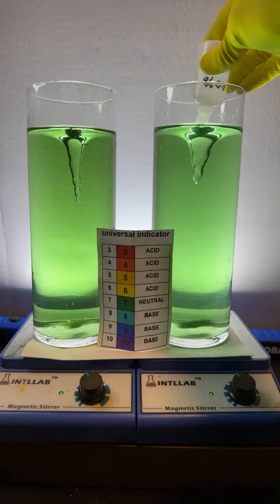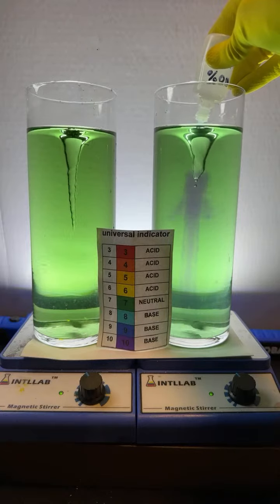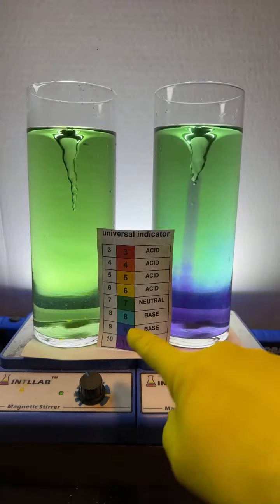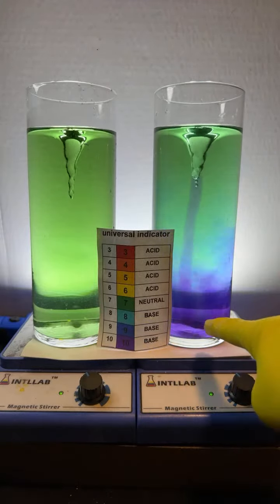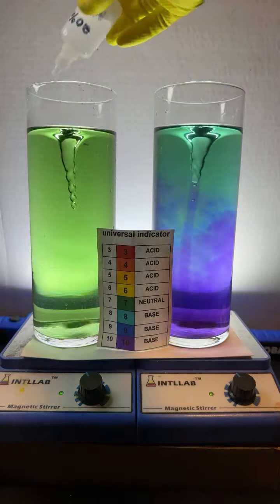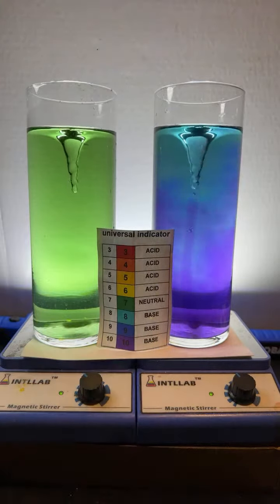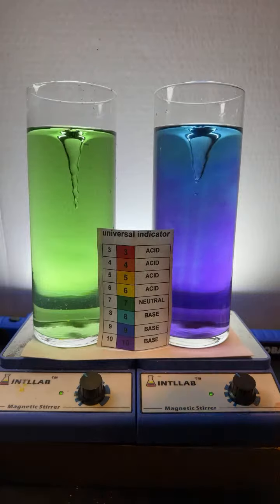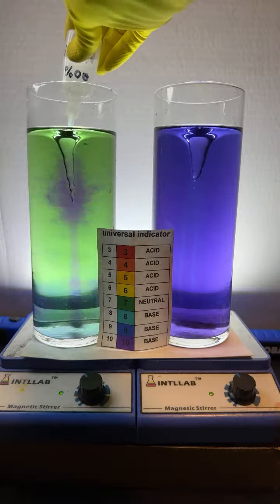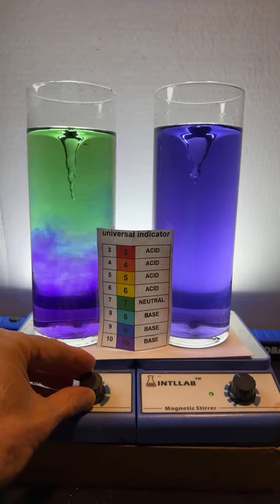I'm going to add a bunch of base here. I'm going to add drops of base, and you can see that it kind of stays in the center. You see that? The material stays in the center. I can see it because that's where the blue stuff is. Now, of course, it gets to the bottom, and it gets pushed down around the sides. I'll do it over here on this side, too. It's not a perfect system because it's kind of small. But imagine an infinite bath of water around this. We wouldn't have to worry about the stuff going down the sides. But notice when I first add the material, it pretty much stays in the center.